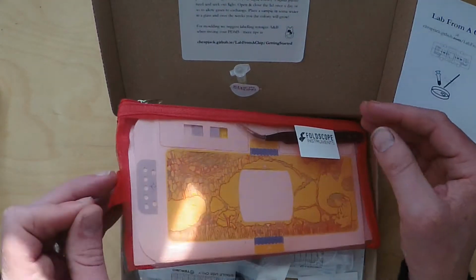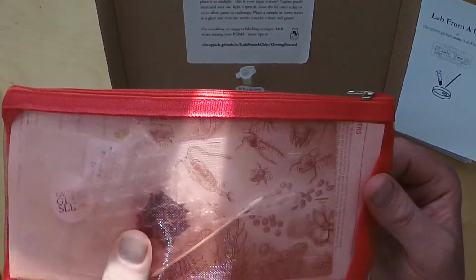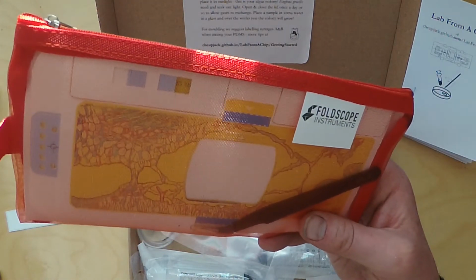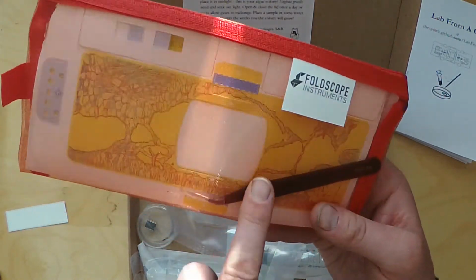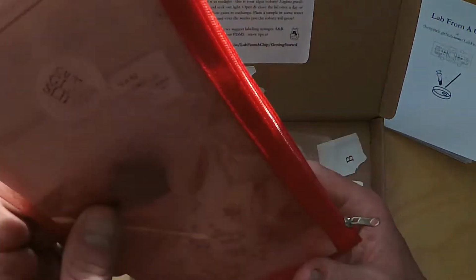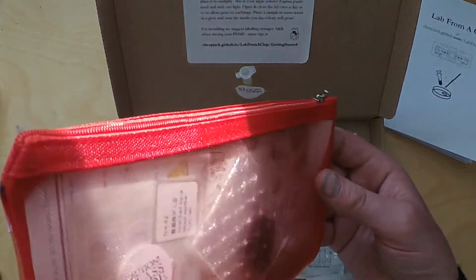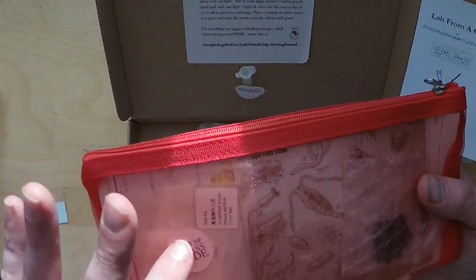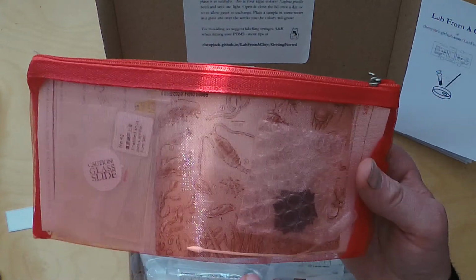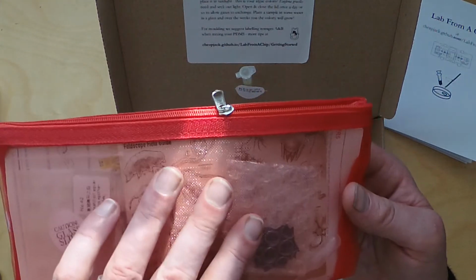Put to one side. What we're going to assemble shortly is the Foldscope kit. This is a standard kit made by Prakash Labs, where we've added a few extras so we can experiment with slide preparation and silicone. There's a nice pair of tweezers in there which you'll find useful not just for this project but all kinds of things. We've got a little package with an example glass slide. You can see a little caution sticker there, just be aware that it is glass and it is possible to break or cut yourself with it, so take care when using it. There's a tiny little pipette in there, and then the rest of the kit that we'll look at shortly.